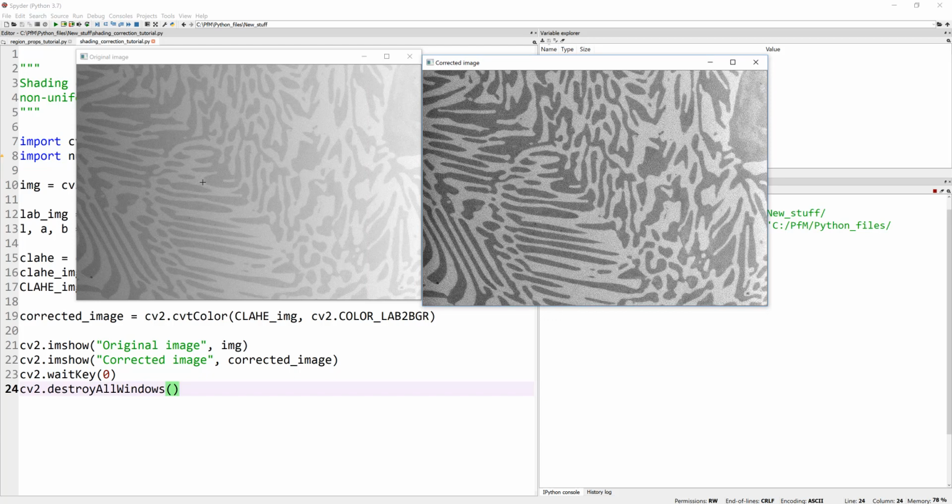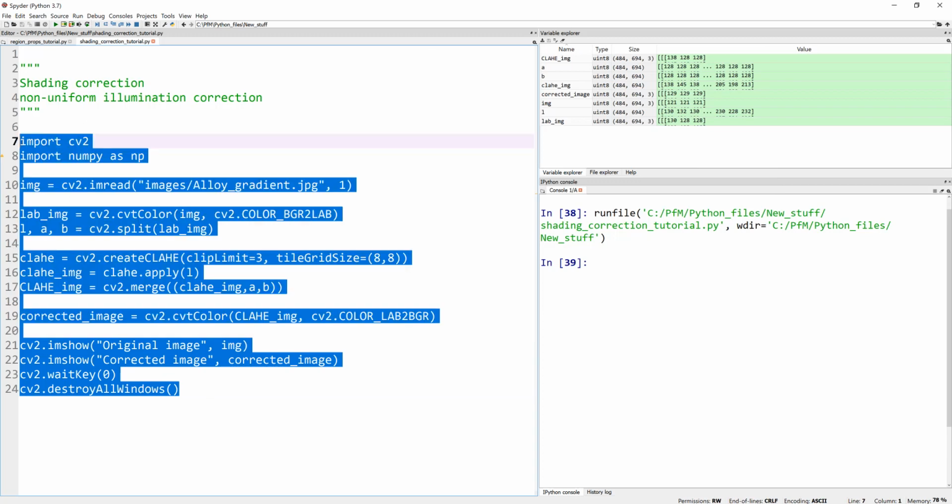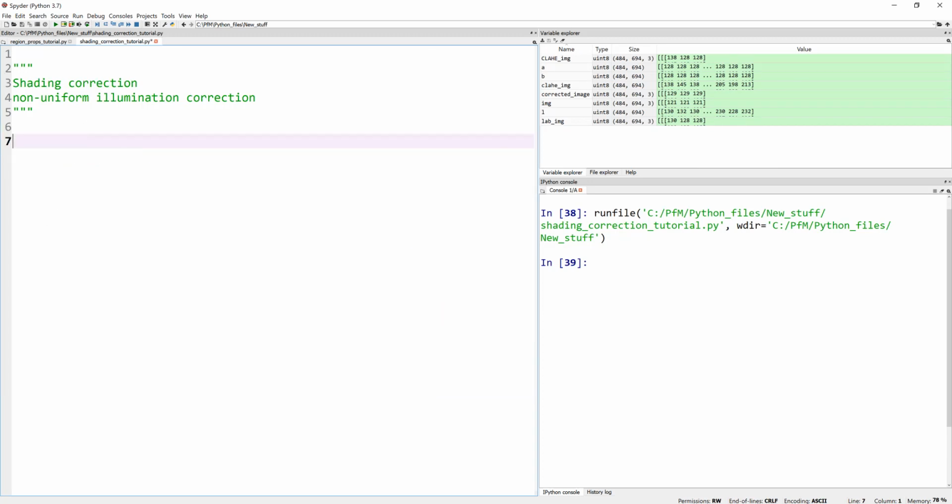It's not bad, actually. I mean, you can see this was our original image and this is our modified image. But if you squint pretty hard, you can actually see that this part of the image is still pretty dark compared to the right-hand side. In fact, if you tried to threshold or segment this image, it would be almost impossible, okay? Using the histogram threshold or Otsu-based thresholding, it is not a great solution. So let's actually do the second part, which is using rolling ball background.